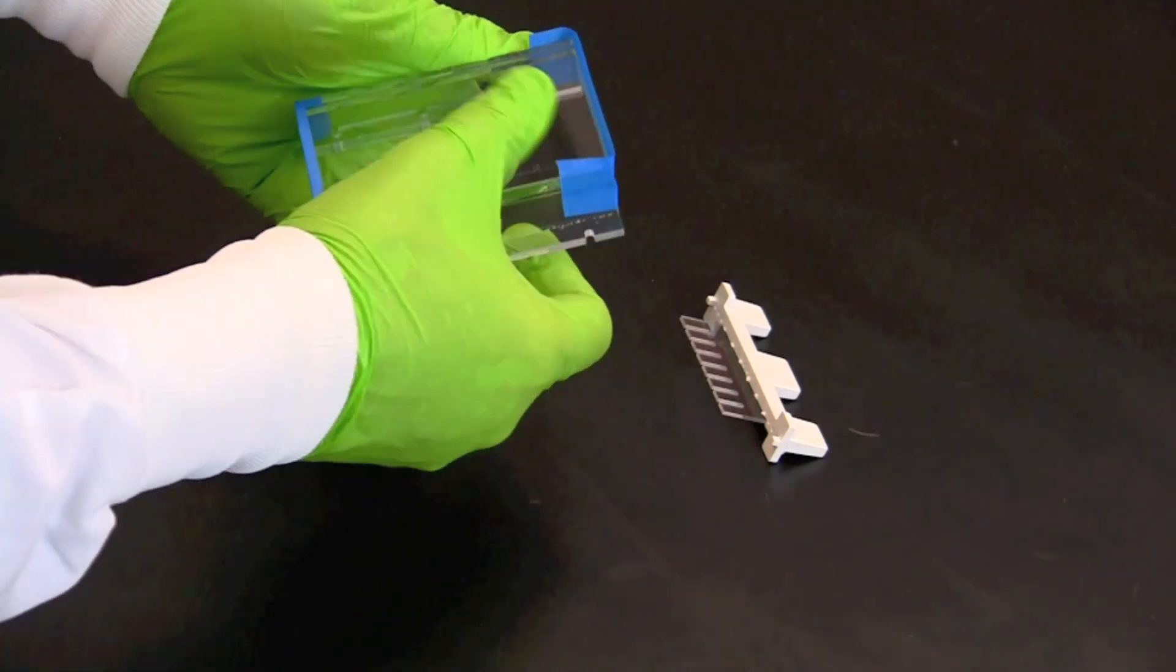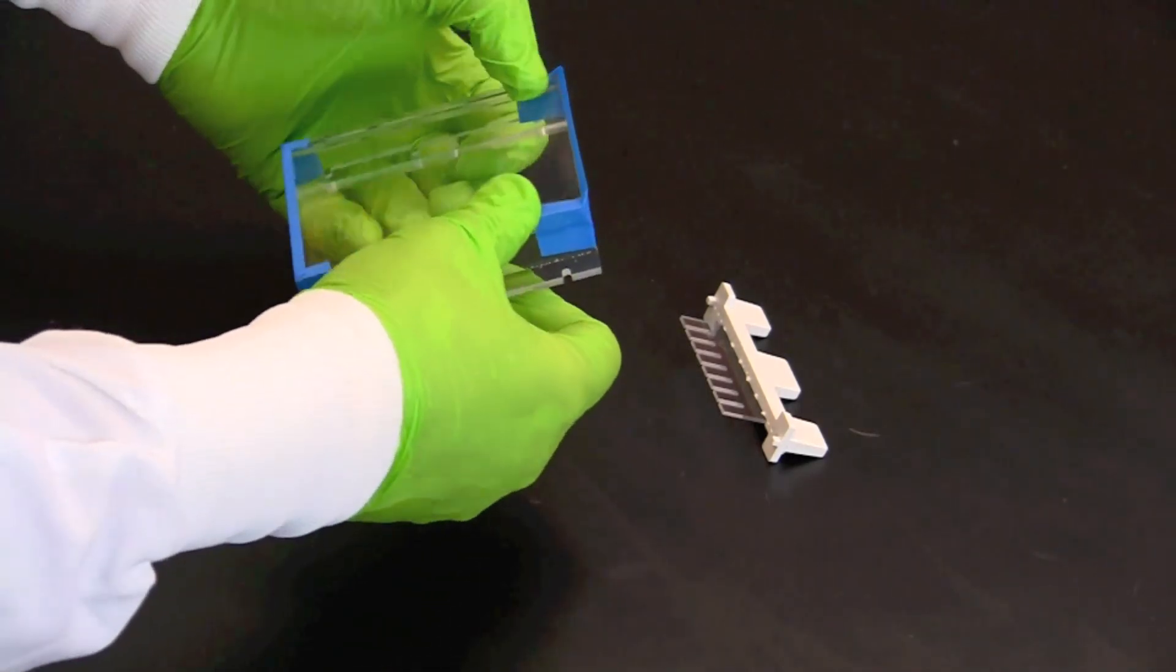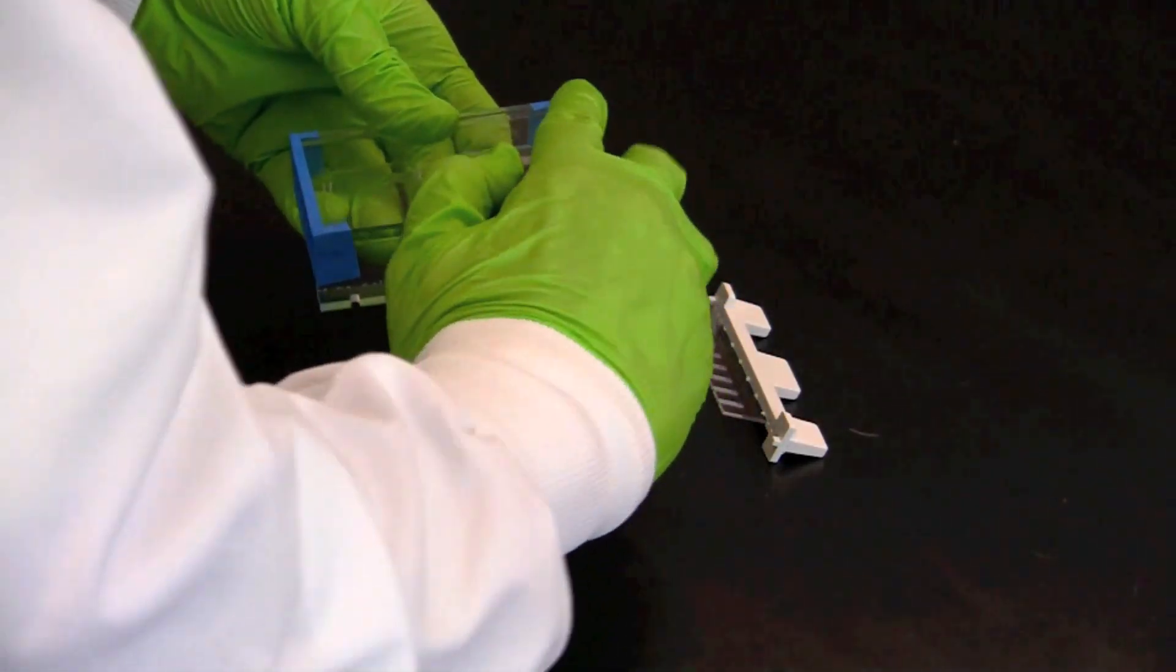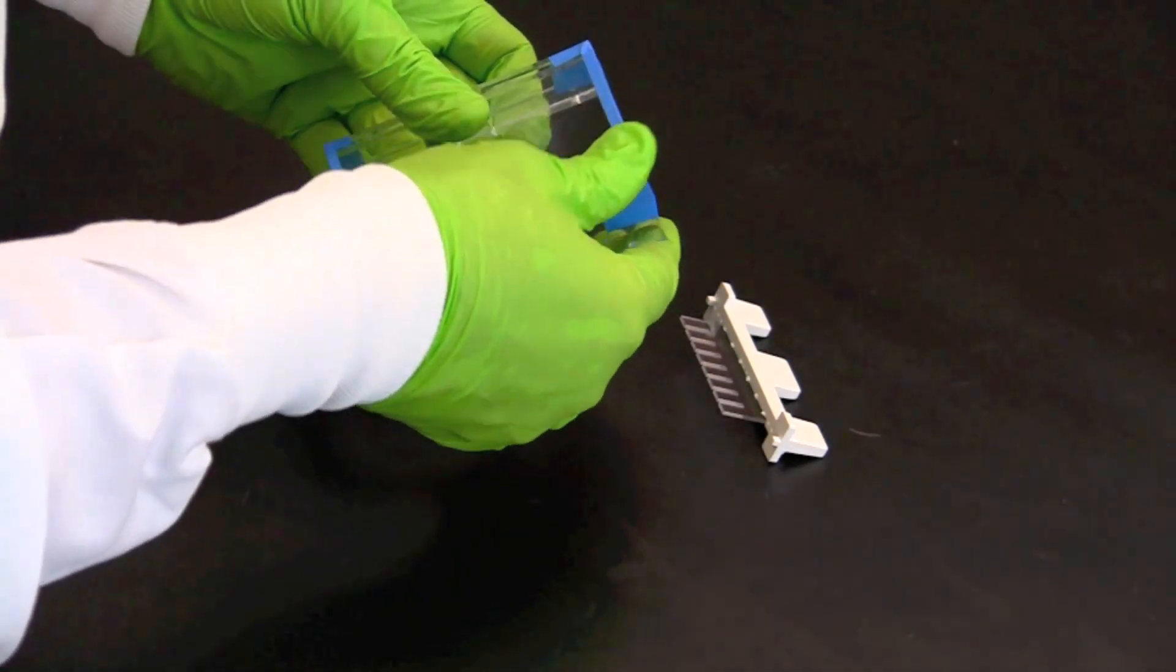Repeat this procedure with the other side of the gel tray, again making certain that each edge has been firmly sealed.